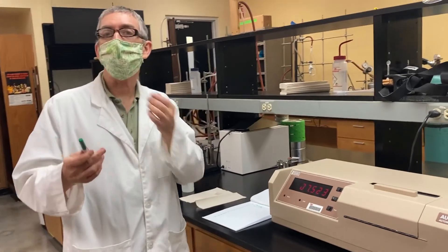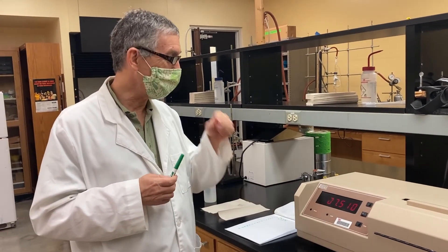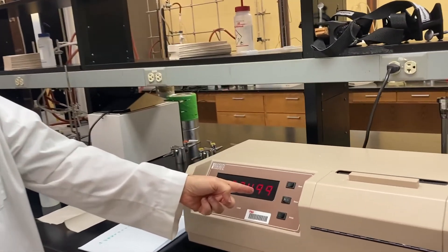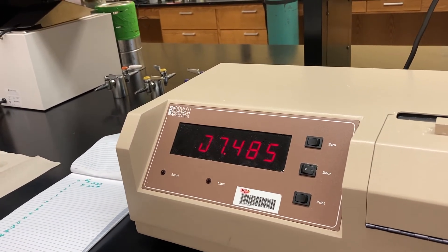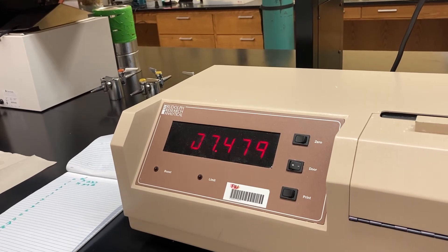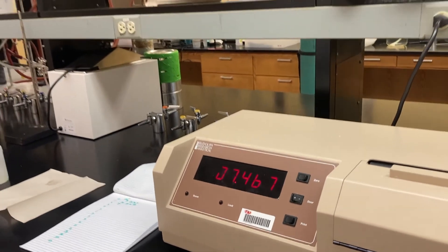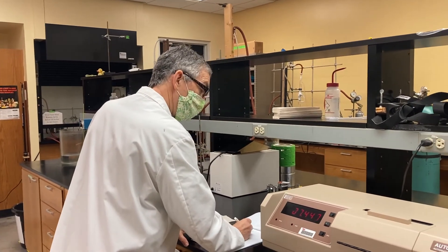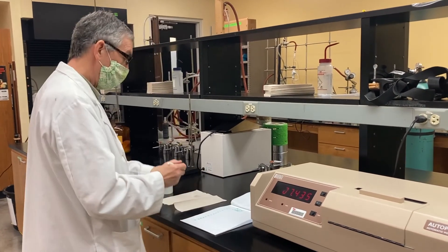Let's do one more of those and then that'll be enough for the demonstration. This is the whole story, right? It's that readout. But you can be quite precise, quite accurate. I mean, I can read that to 1,000th when he says, you know, zero. So I can be really quite accurate. As long as there's no drift in here, as long as we know our concentrations precisely and accurately, we can get very good data here. 10, 9, 8, 7, 6, 5, 4, 3, 2, 1, and zero. Got it. 7.438.